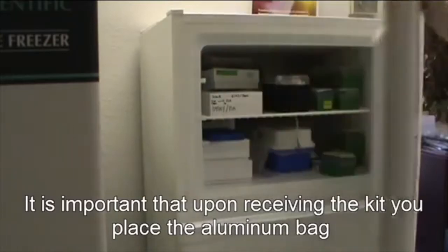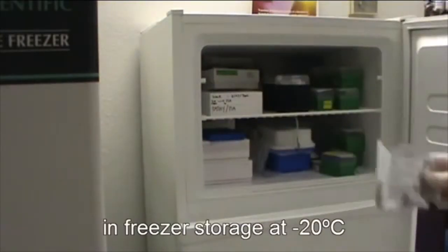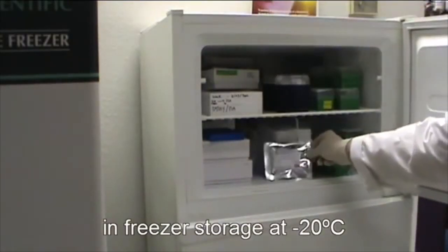It is important upon receiving the kit you place the aluminum bag in a freezer storage at minus 20 degrees Celsius.